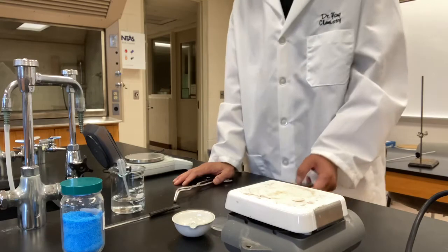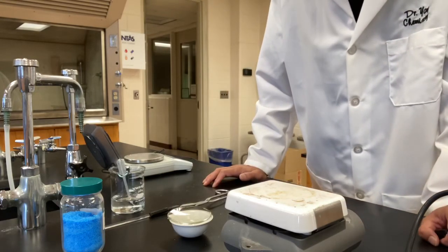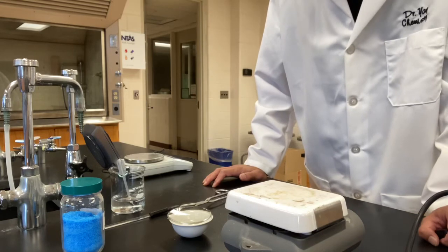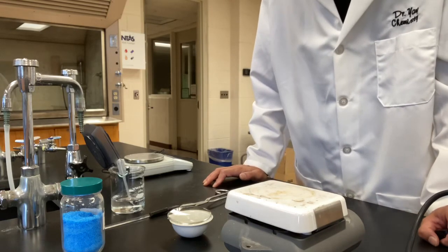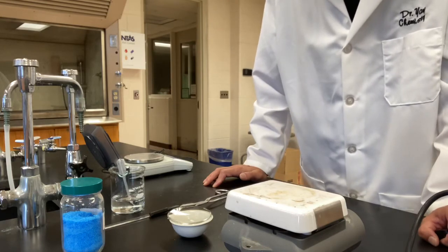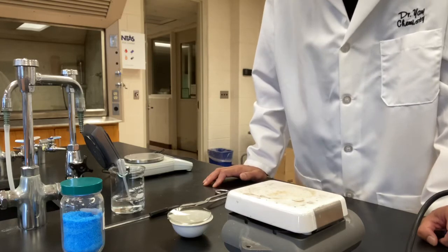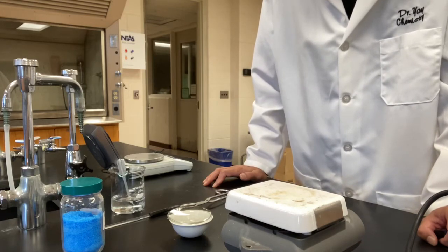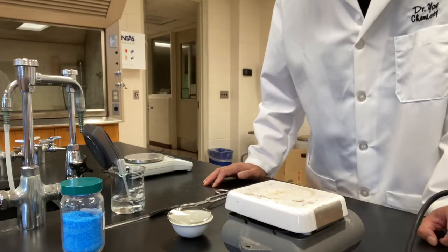So we're done with the measurement. By this time, we have all the data we need for this experiment. All the other numbers on your report sheet are actually calculations based on this measurement. Please make sure when you do these calculations, you follow the operational rules for measurements.